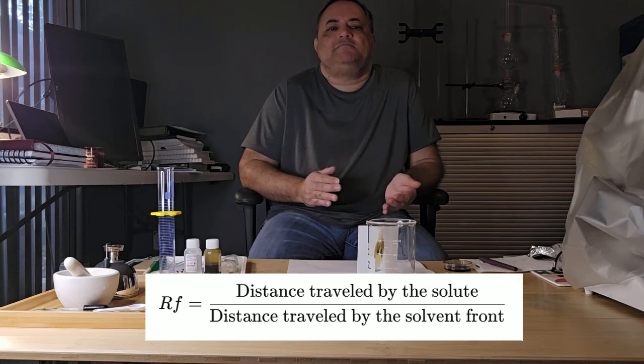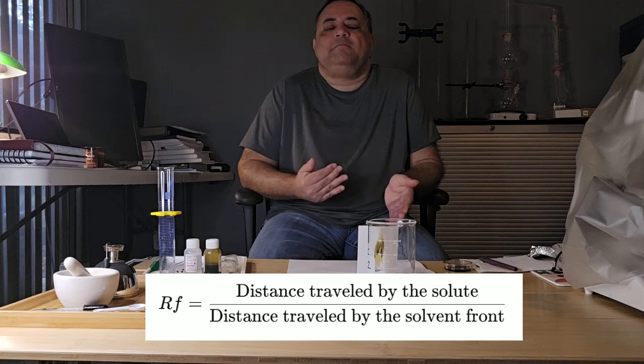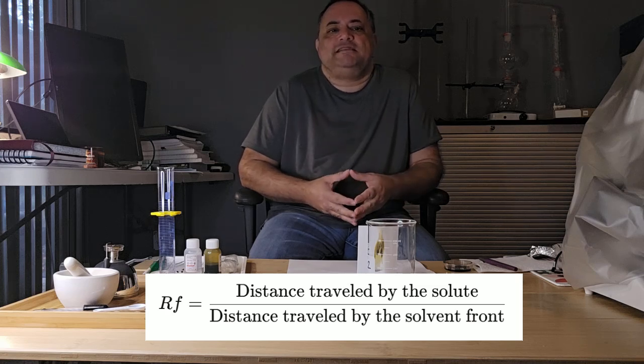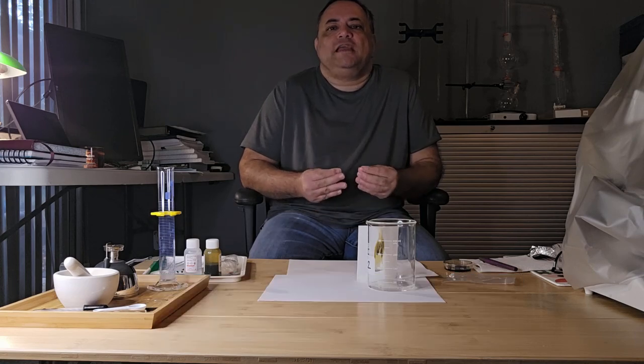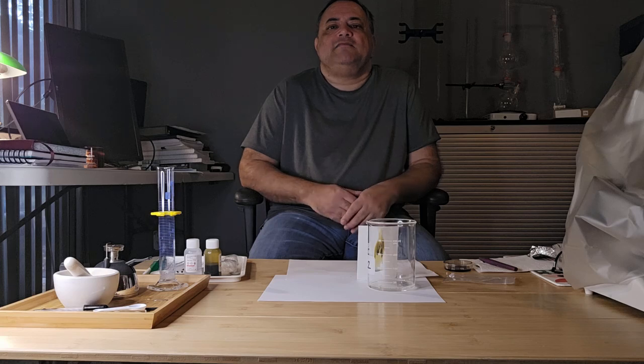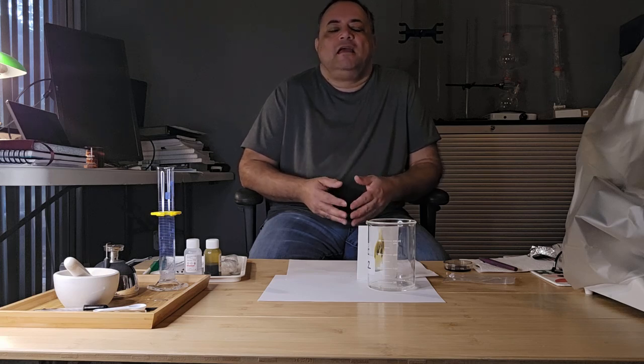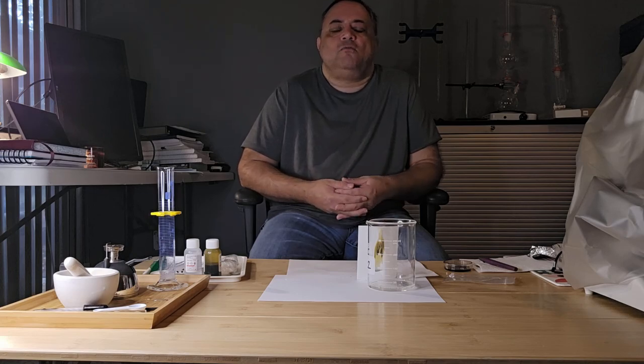So it's distance by sample divided by distance by solvent. That is your retention factor, and you can use that in identifying specific components within a mixture and comparing it against a control, or if you didn't have any controls to compare to but have known RF values, then by your calculations, you can identify the component.